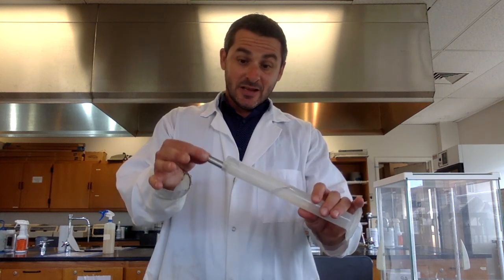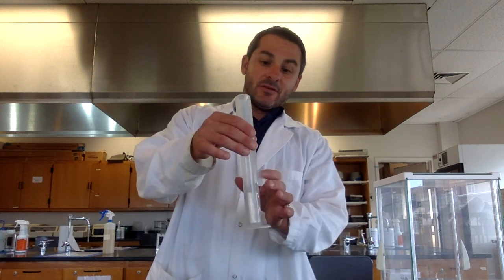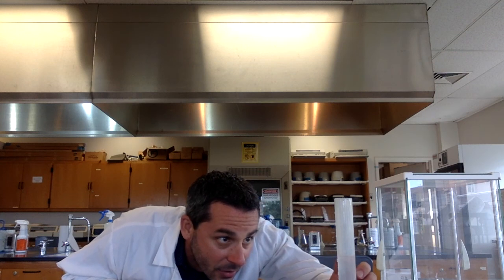So I'm going to hold it diagonally and slide it in there. Now, get rid of any bubbles, the volume has increased. The increased volume is due to the metal. So whatever the volume of the metal is, that's how much the volume now increased. So I read it again, no bubbles. And now it is about 64.8, we will say.